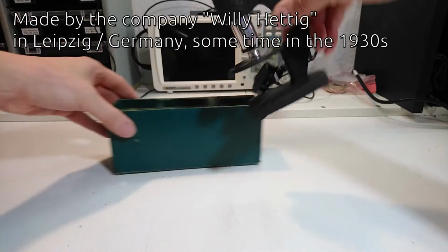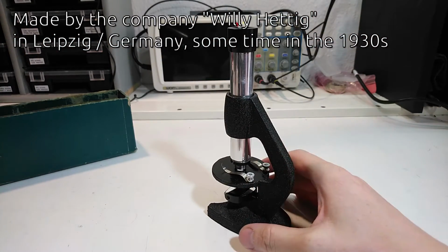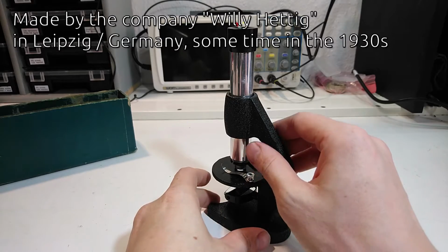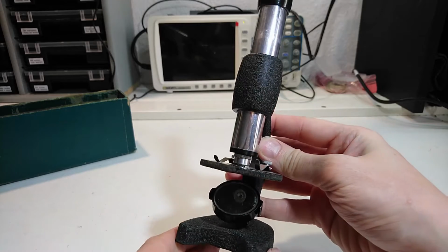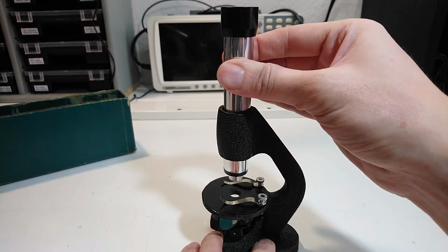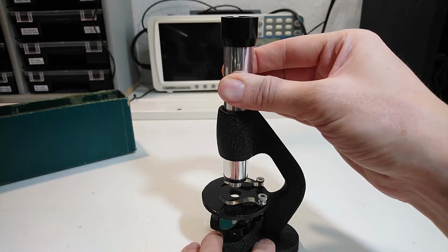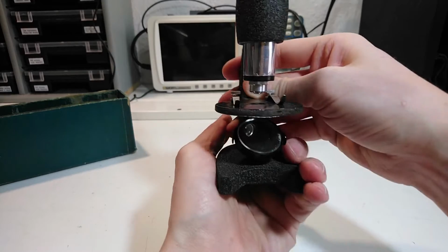In the box is a very old, very simple school student's microscope. But I don't think that it is rare, overly valuable, or a collectible, and I paid next to nothing for it. The microscope is very simple indeed, and the construction can be described best as rough.